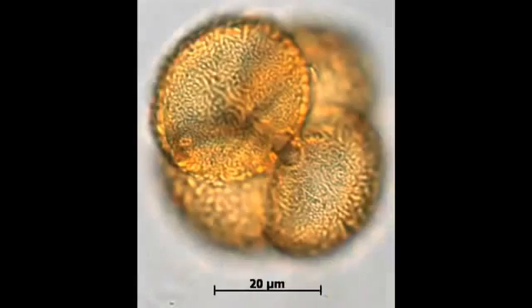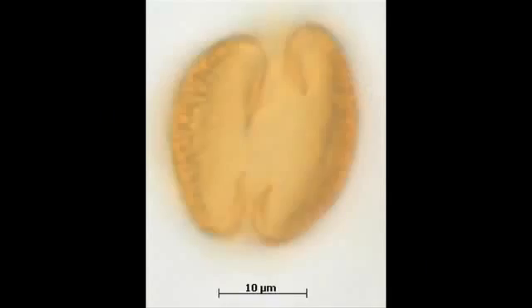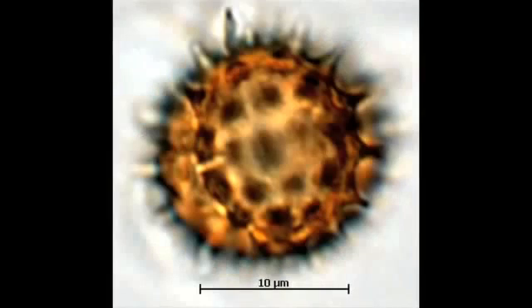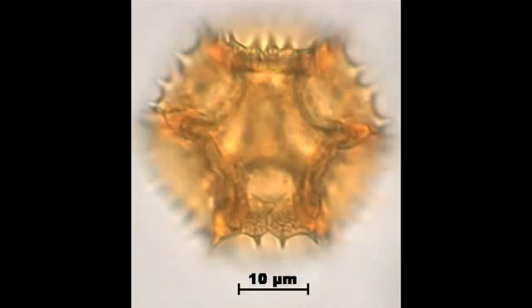Under the microscope, grains of pollen look incredibly varied. But each species has its own shape and structure, as individual as a fingerprint. Some pollen is really round and has air sacs, so that's usually wind pollinated. Others have spikes on them, so that's more insect pollinated. Some are bigger and they're pollinated by birds.